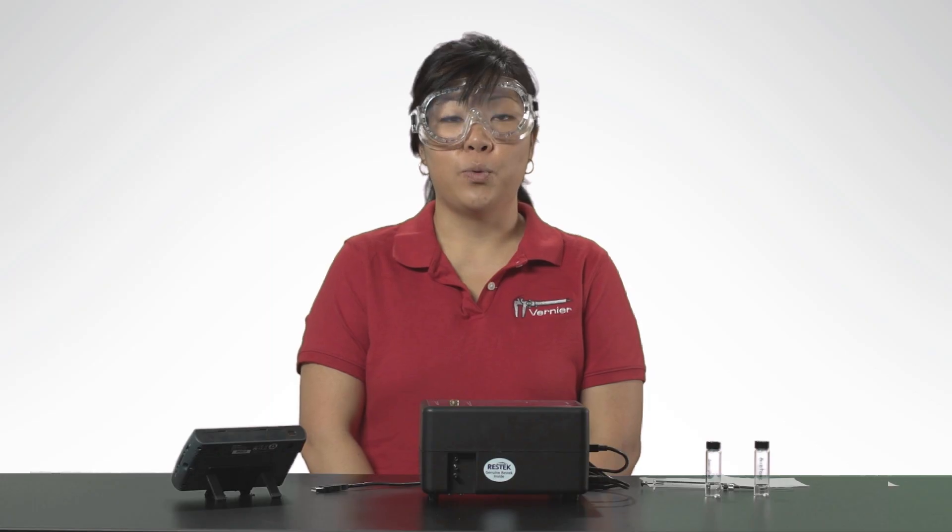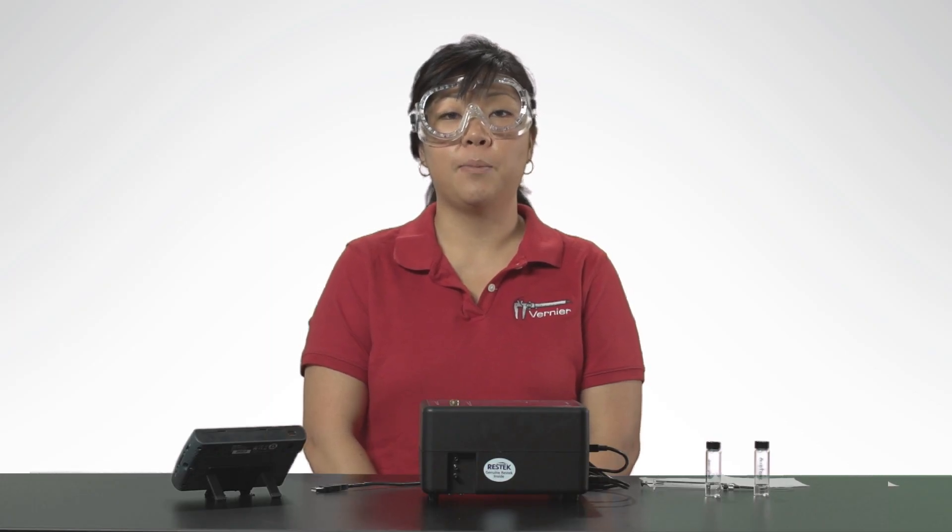Make sure LabQuest 2 has been updated to 2.1 or newer. This free update is available on our website. You will need a 1 µL syringe, a vial of ethanol or acetone to rinse your syringe, and your sample.